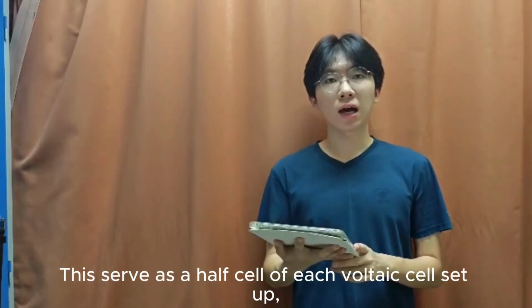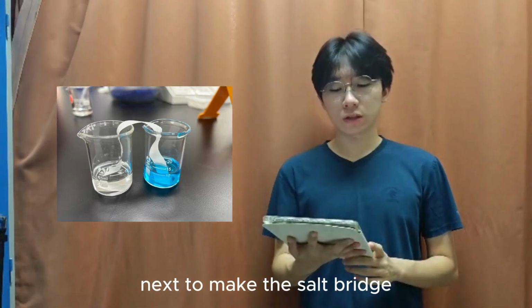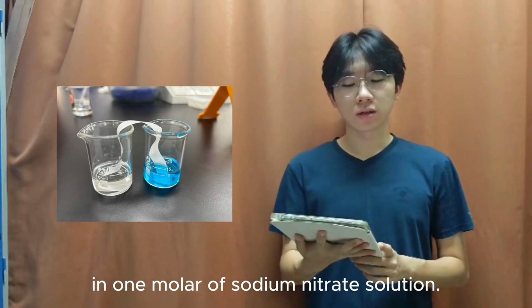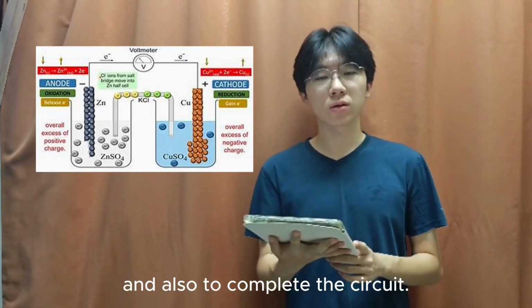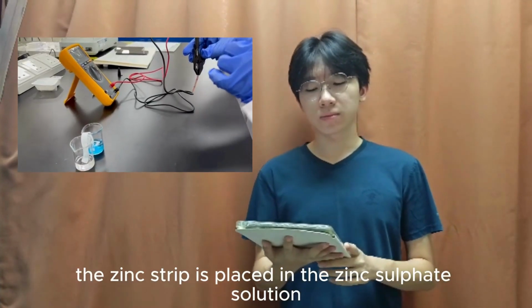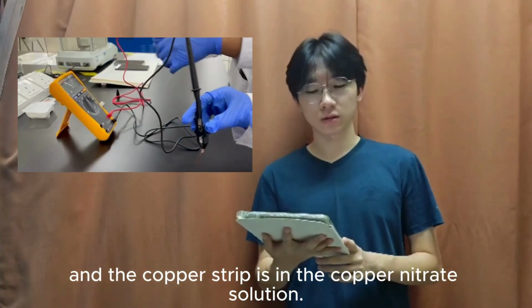These serve as a half cell of each voltaic cell setup. Next, to make the salt bridge, we soak a strip of filter paper in 1 molar sodium nitrate solution. The salt bridge allows ions to flow freely between the half cells and also to complete the circuit. Now we construct the zinc copper voltaic cell. The zinc strip is placed in the zinc solution and the copper strip is in the copper solution.